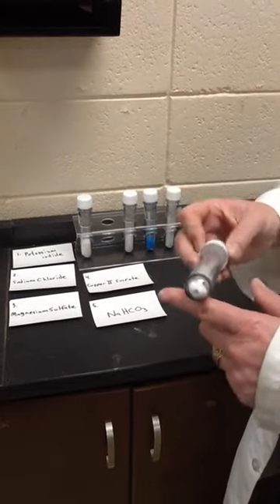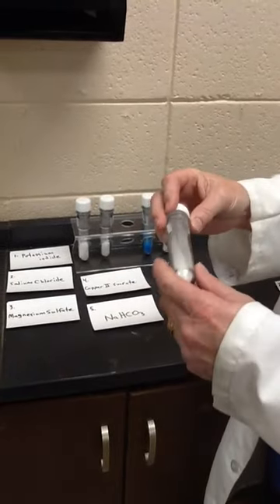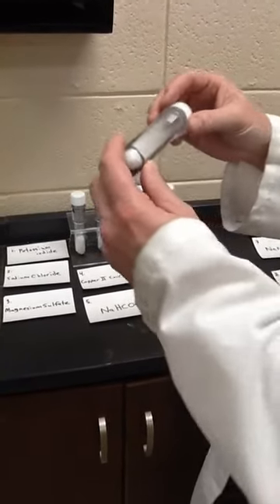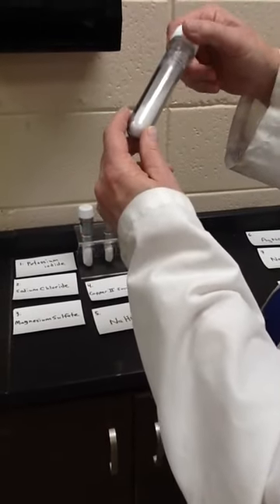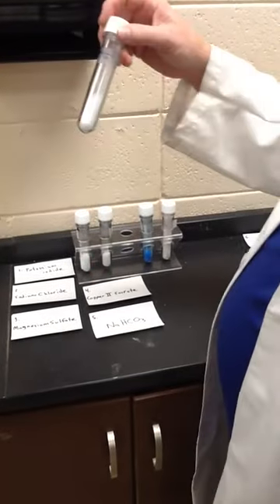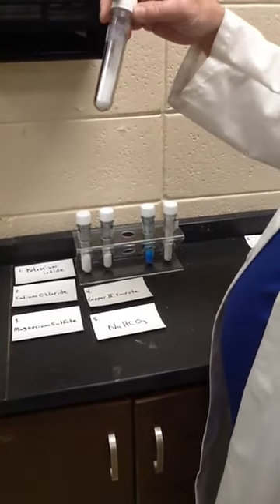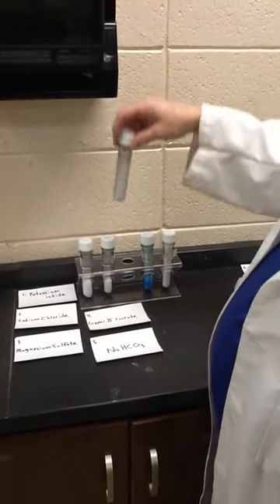Sodium chloride. And if you see, it's a fine crystalline powder. If you haven't seen it under the microscope, I'll set one up. It's amazing to see. In somewhat more transparent, clear, larger, chunkier crystals, we have magnesium sulfate. You can buy this at Walmart as Epsom salts.